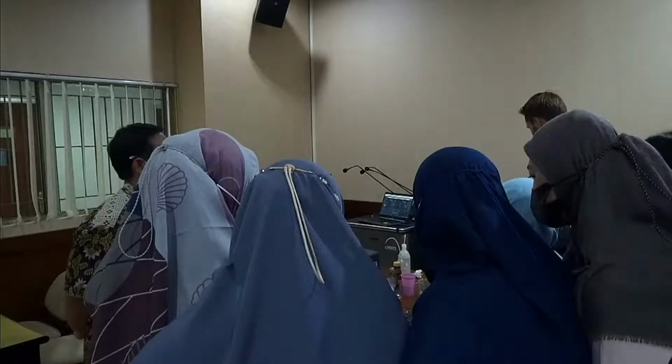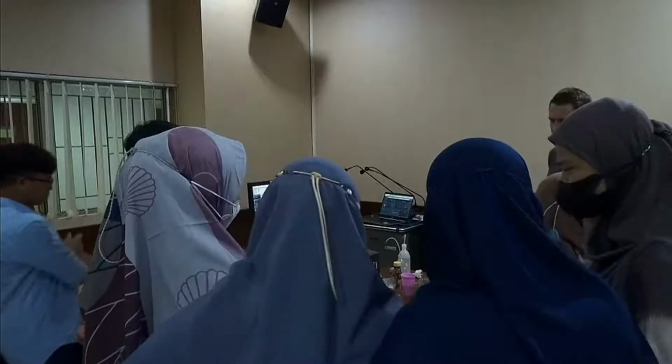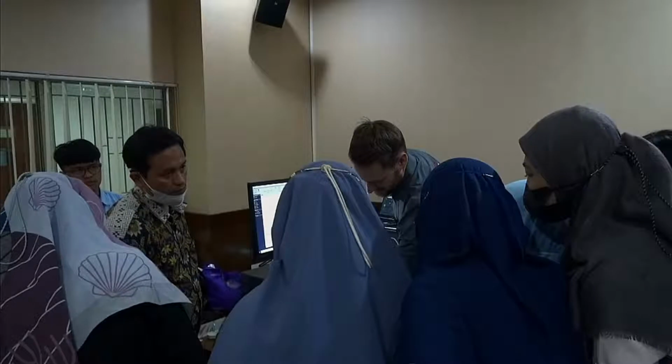Also, we have this accessory suitcase coming with some tools for connecting water. Normally, you would have water connected here, so from the tap.